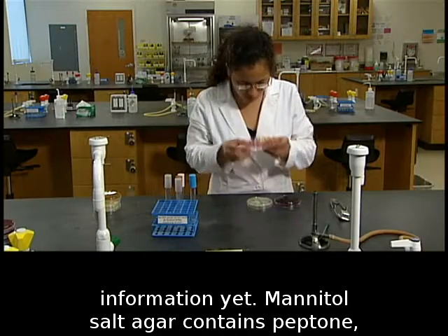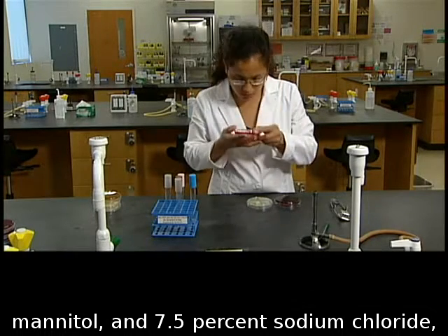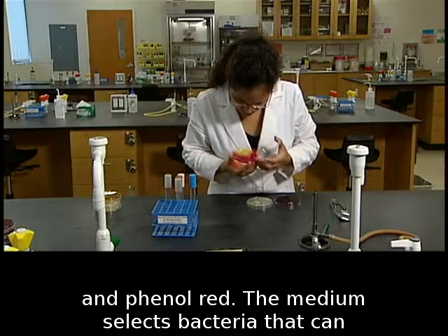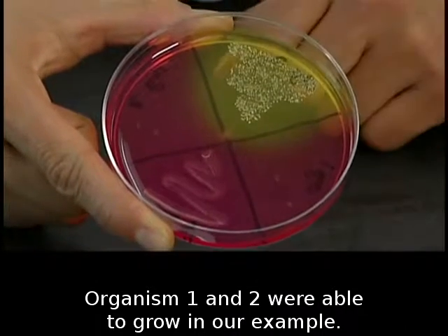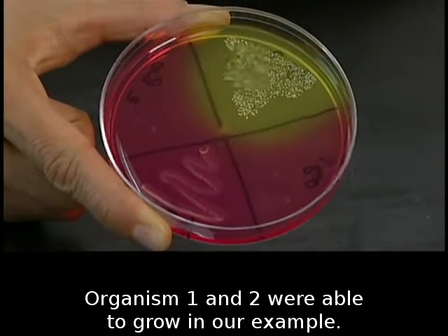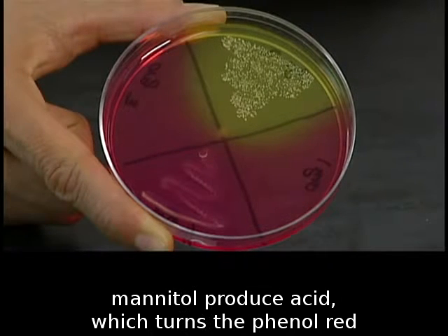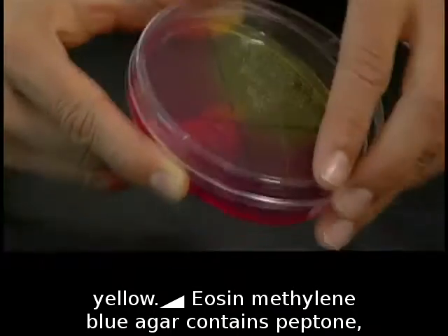Mannitol salt agar contains peptone, mannitol, and 7.5% sodium chloride and phenol red. The medium selects bacteria that can tolerate the high salt concentration. Organisms 1 and 2 were able to grow in our example. Phenol red is a pH indicator. Bacteria that ferment mannitol produce acid, which turns the phenol red yellow.